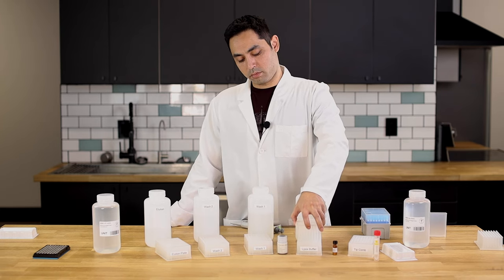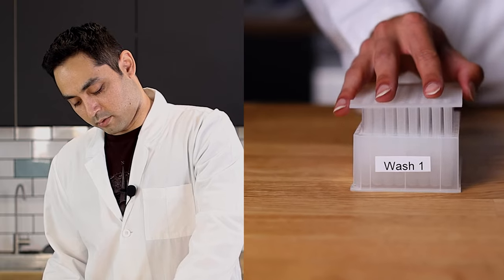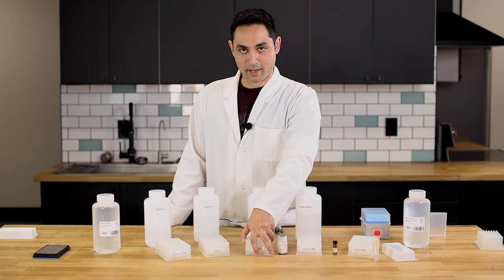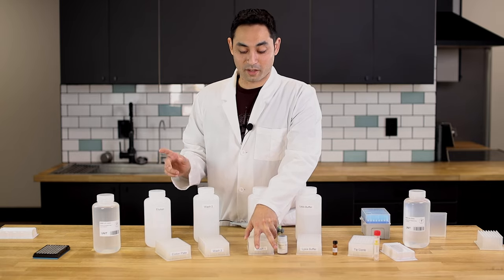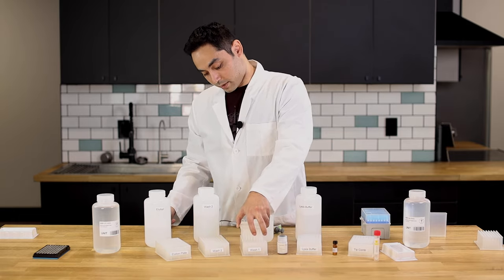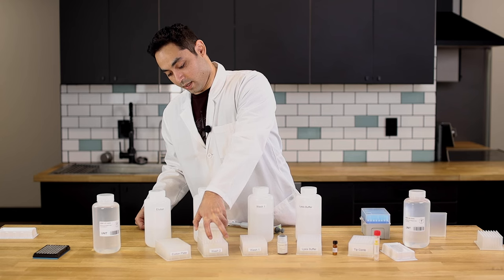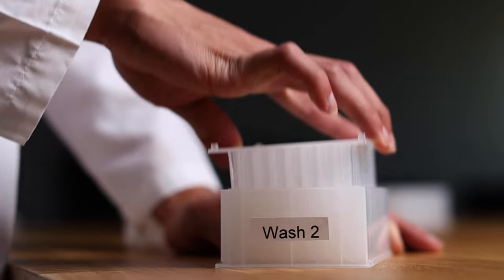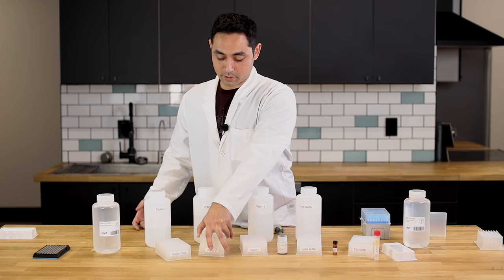It's gonna pick it up again, go over, and agitate it for a good wash. Finally, for good measure, we're gonna do one more wash with ethanol. The magnetic rods are on, the magnetic beads with the RNA go over to the ethanol, and it agitates for a few minutes.